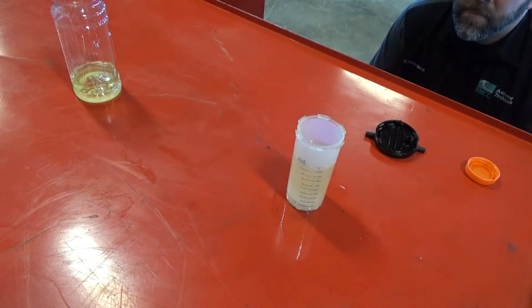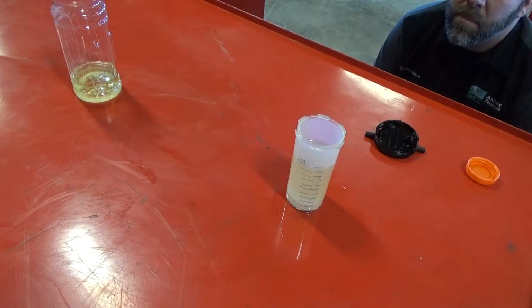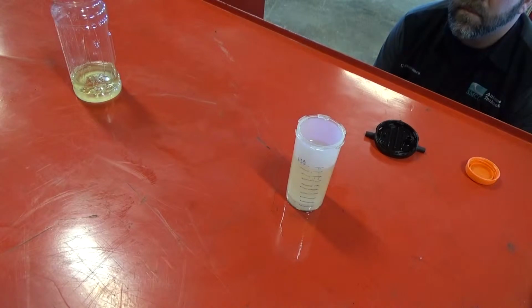So now, as it settles out, we should see that division line of the fuel floating on top of the water. It should actually raise up a little bit, and the water content will be a little bit thicker than what it was. Because again, we started with 10, we see what it gets. I may have to stir this too, so I'll get a stir stick.